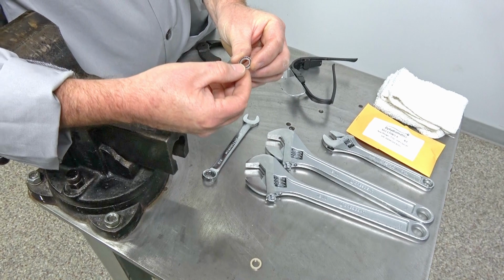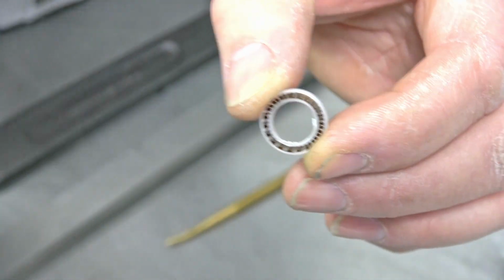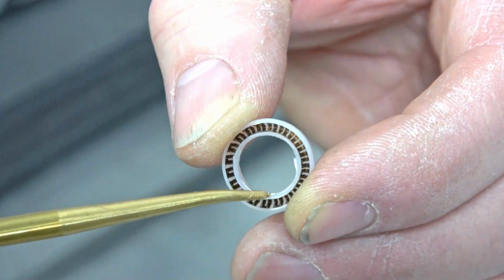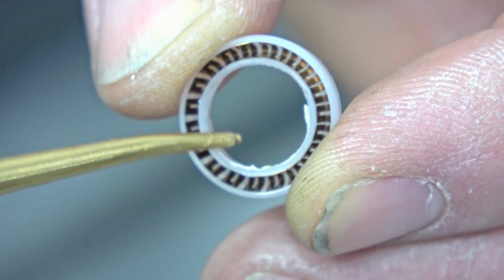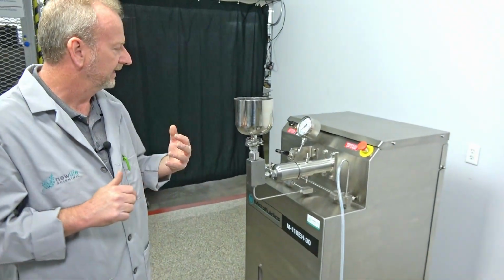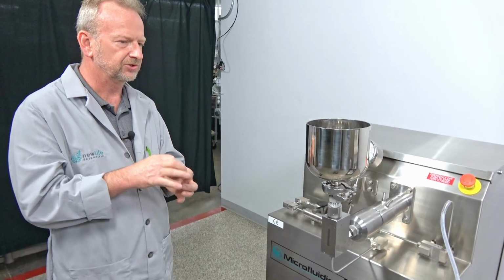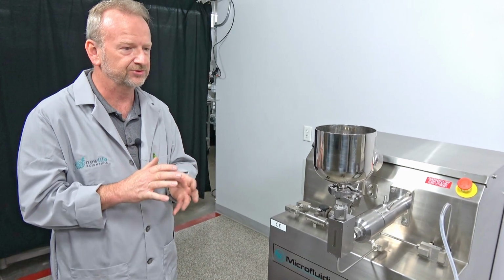But on this one here, I doubt you're going to be able to see it on the camera, but we'll see. I'm going to point out, you can see this seal here is blown, and it's been damaged right on this edge around here. I changed this one out yesterday, so we already have a new seal in here, but I'm going to take it apart and show you how to replace it. I'll get right down to the actual removing of the seal, and I probably won't remove it because I don't want to risk damaging a brand new seal.